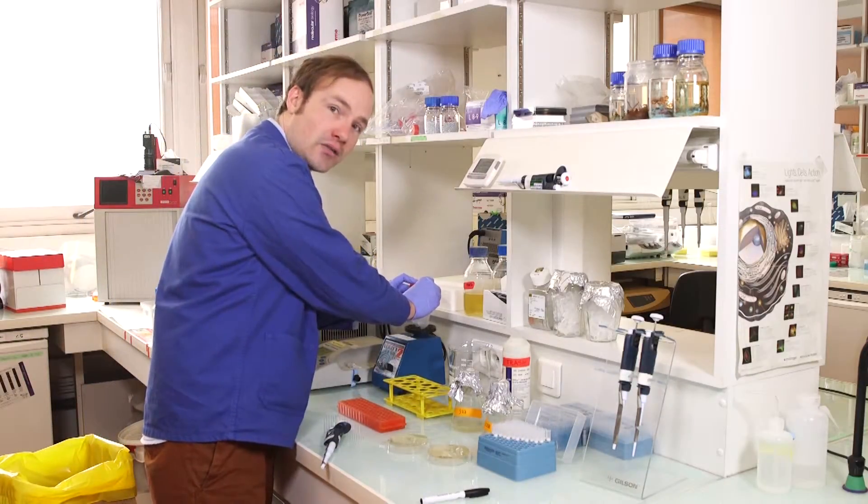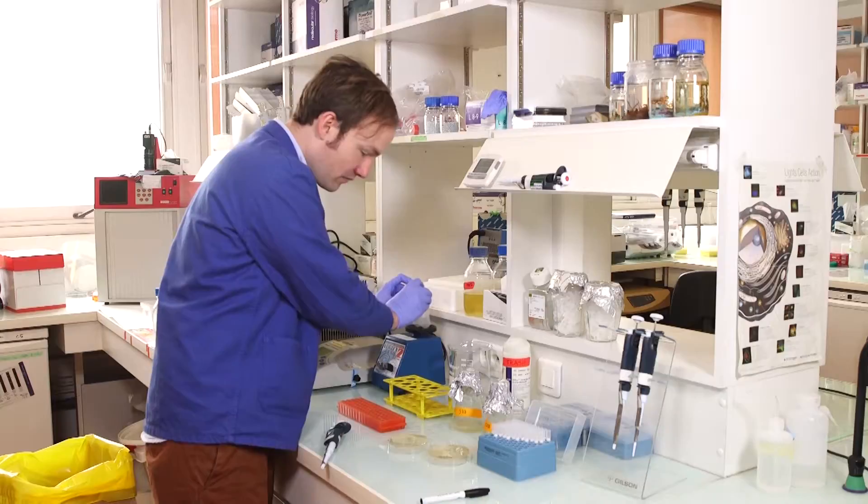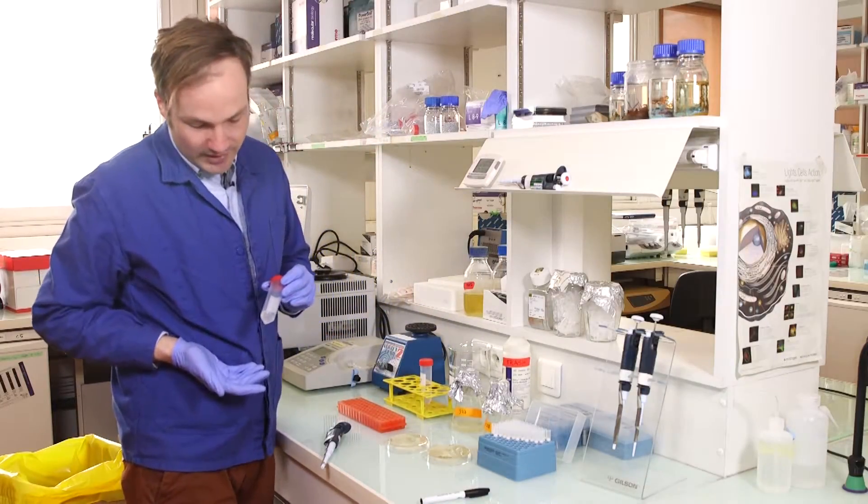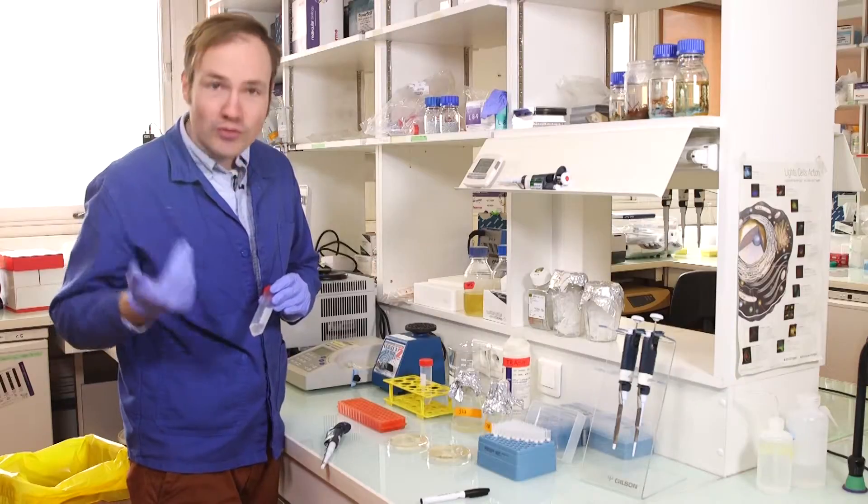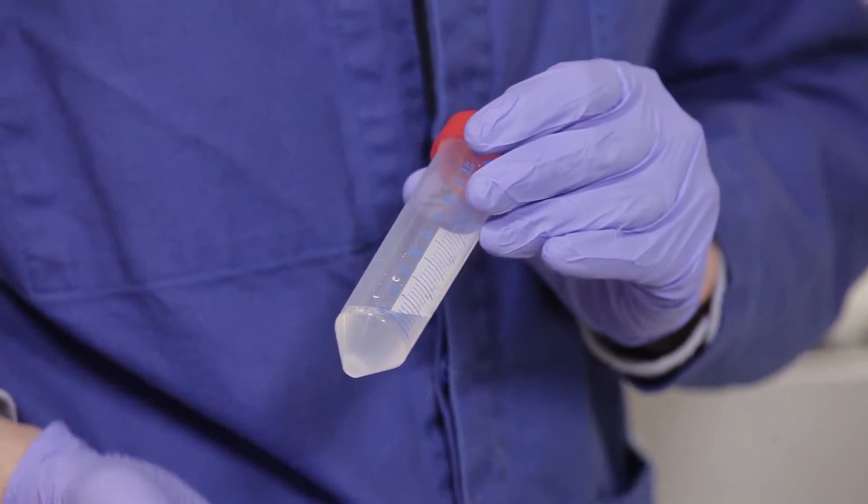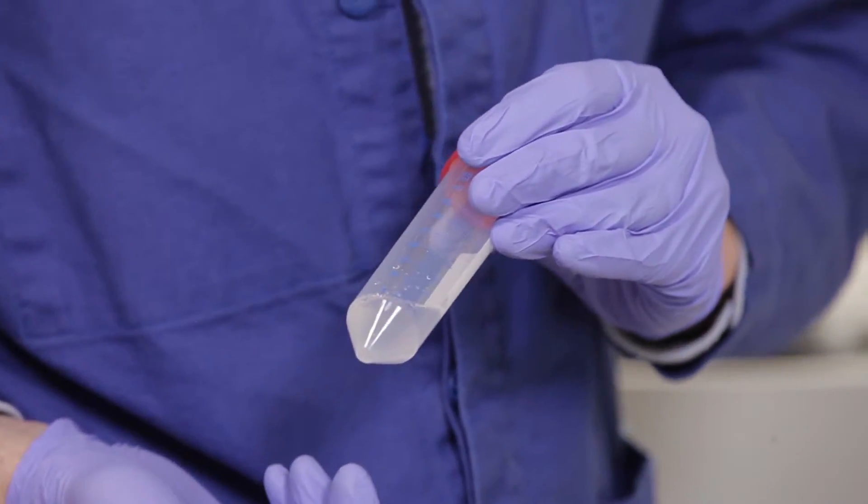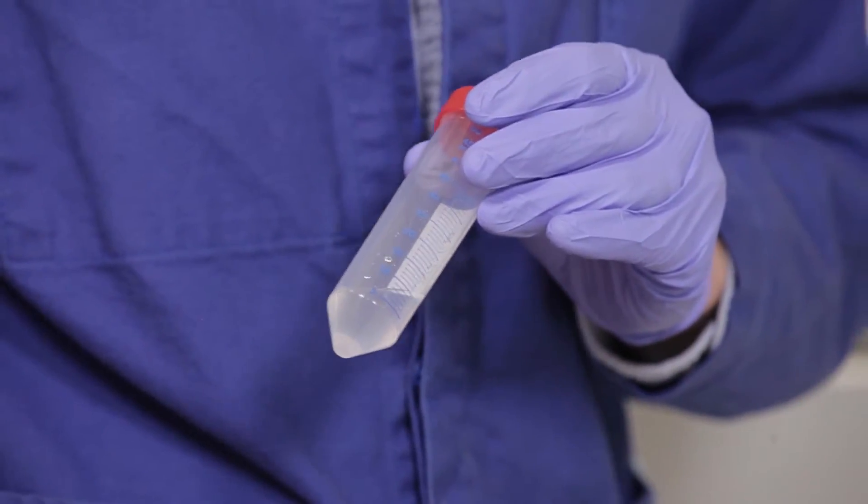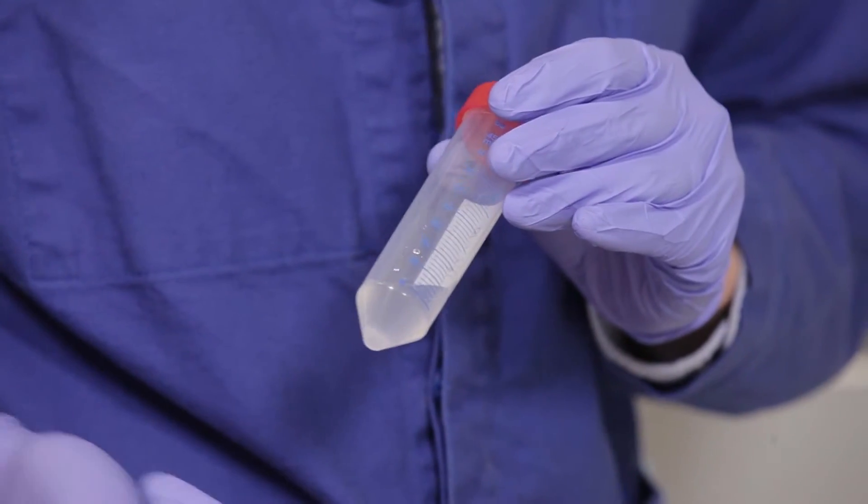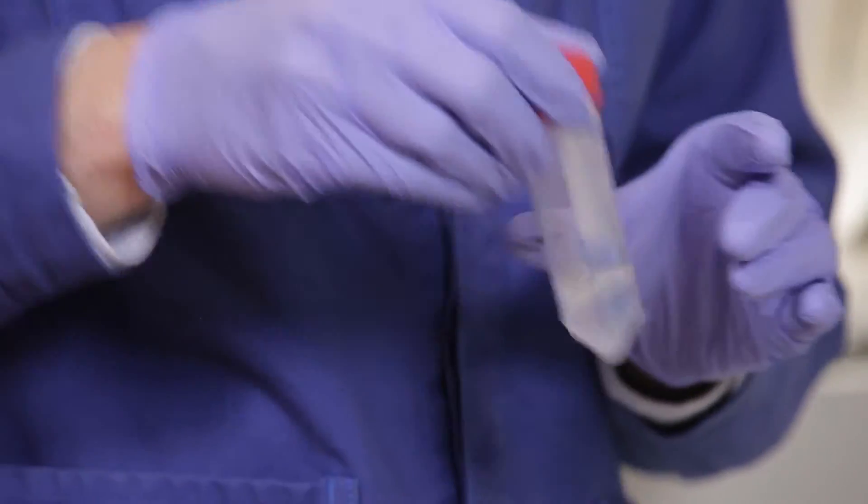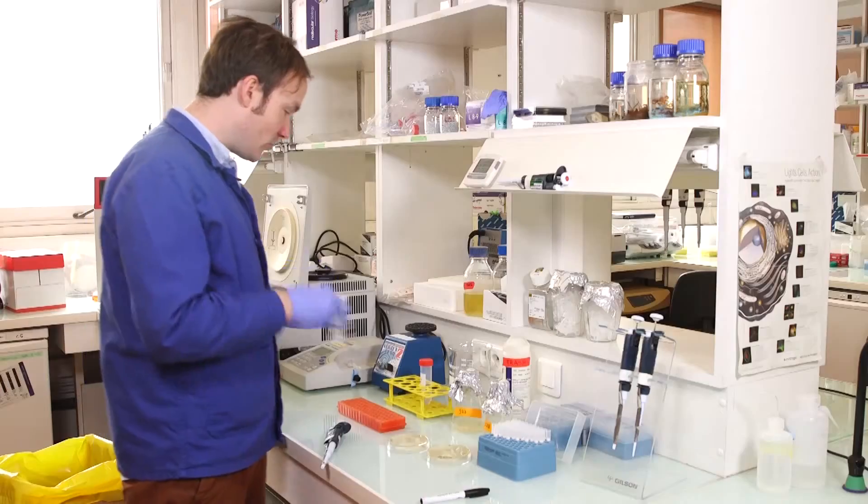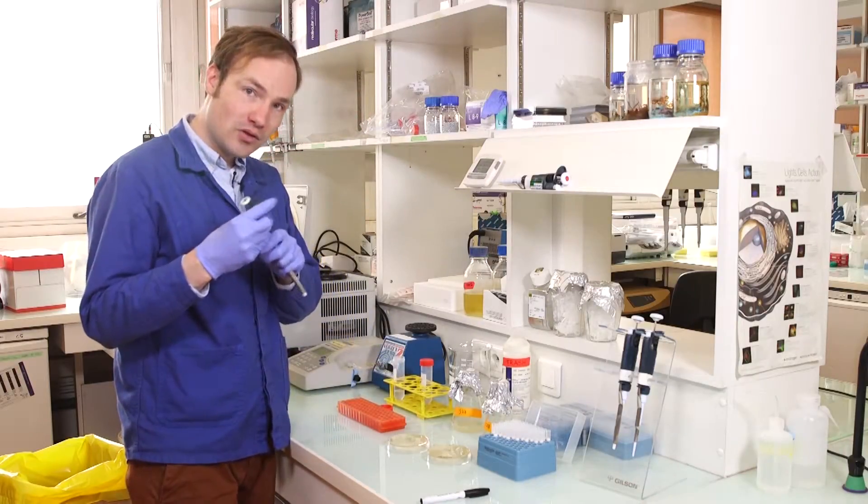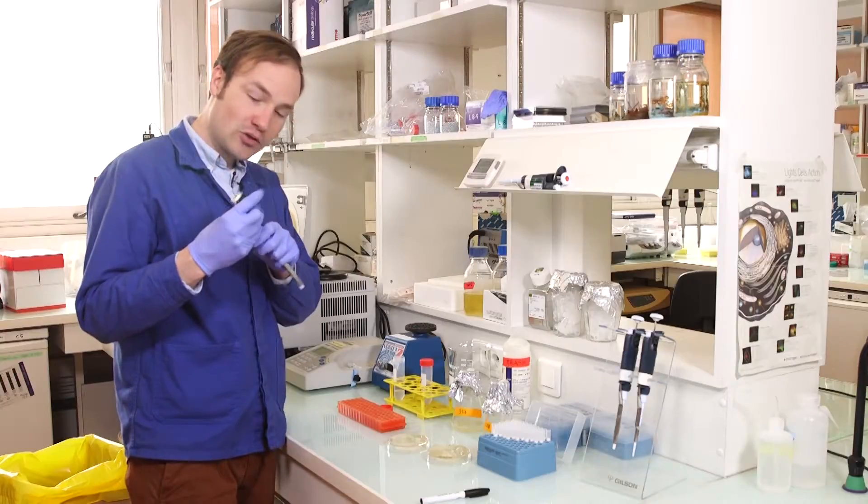Give them another vortex. And now, looking at a culture like that, I can just sort of tell by eye that this is where we want to be for an absorbance measurement or a fluorescence measurement. It's cloudy, but I can still see through it, which means it's going to be roughly in the linear range of our OD measurements. But just to be safe, I'm going to take a quick measurement of the OD here on my benchtop spectrophotometer.